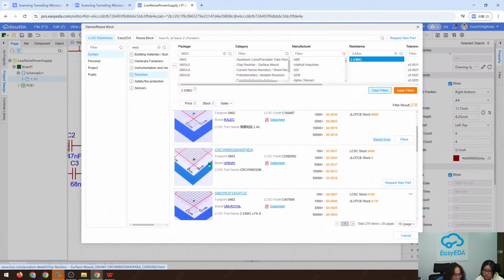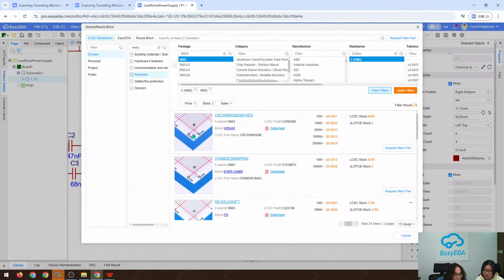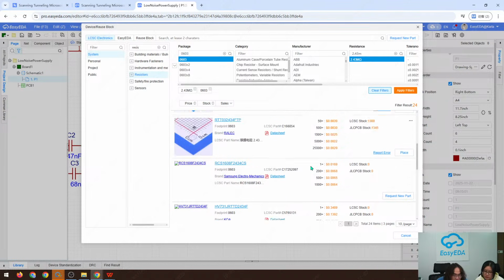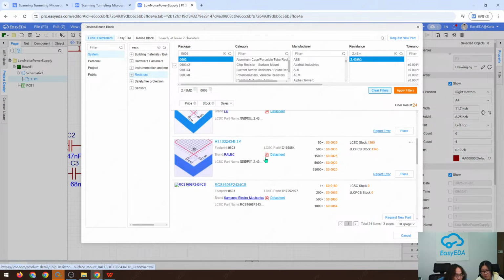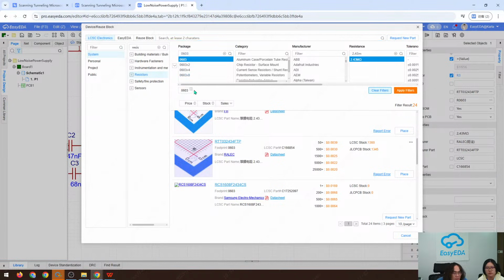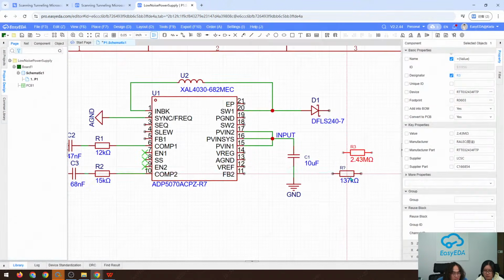So it's very time consuming to choose this. However, once you finish your design, if all your designs are in our library, you can just order all of your components at once. Maybe this is not available since it is a sample. Yeah, this is good. 137K.